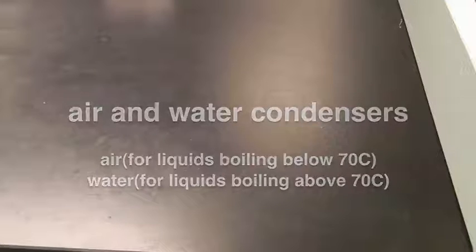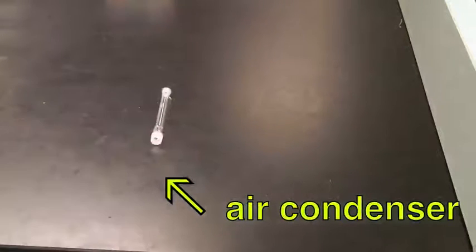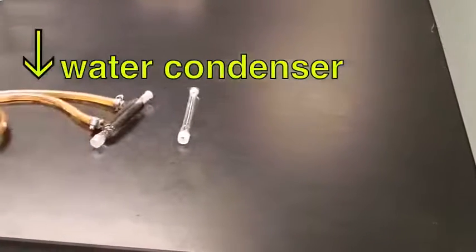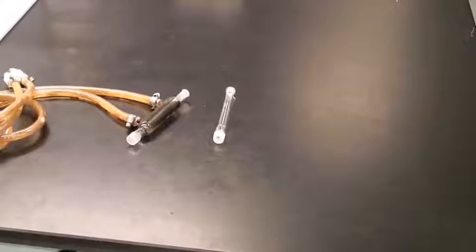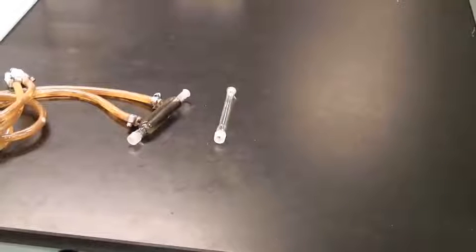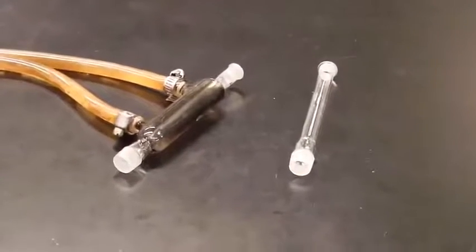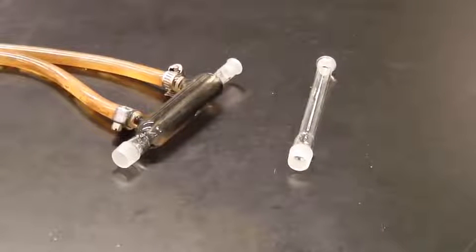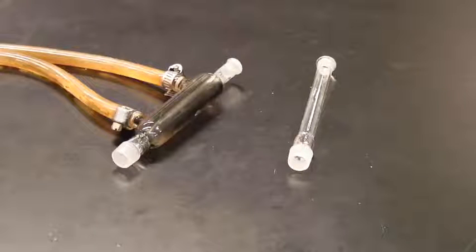Condensers are heat exchangers. They come in two varieties: the air-cooled condenser and the water-cooled condenser, used in different situations. You use an air condenser if the boiling point of the solvent is fairly low — below 50 or 70 degrees. You use a water condenser if the boiling point is higher, because you need the water to carry away the heat of the vapor as it condenses.